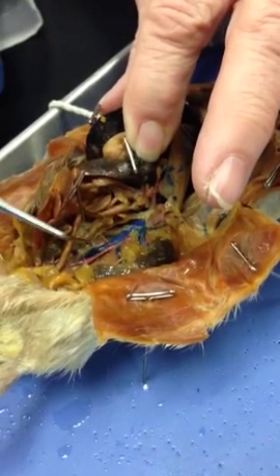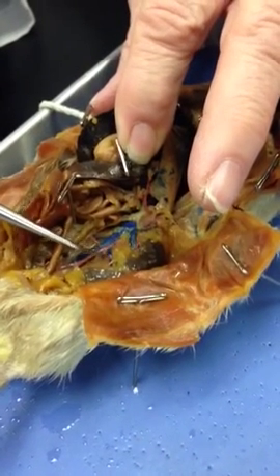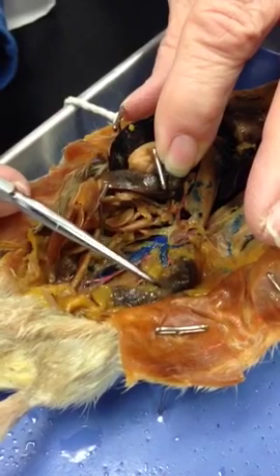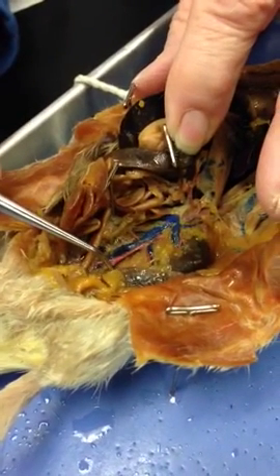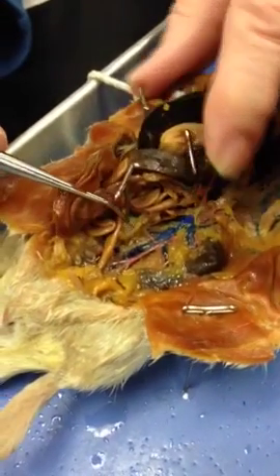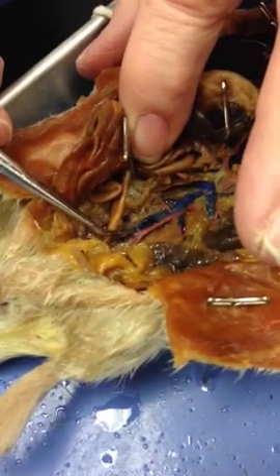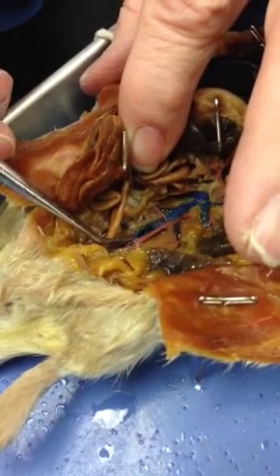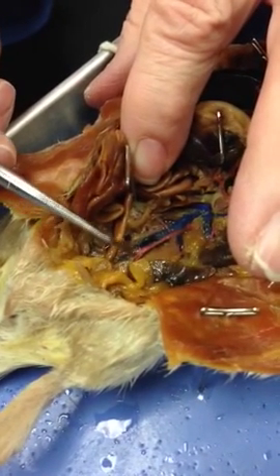And then we go on down, and then we have the gonadals that are going out to the side, because this is a female because of her ovaries and uterus. They'll come out and go down in the male to the testes. Then this tiny, tiny little one right there, that would be the inferior mesenteric or posterior mesenteric going to the large intestine. Then you get the bifurcation, divides into two.